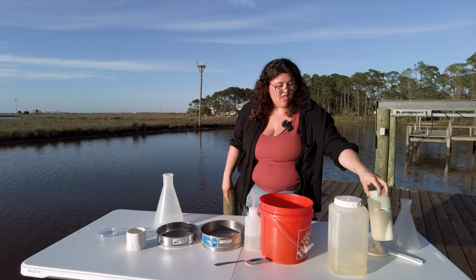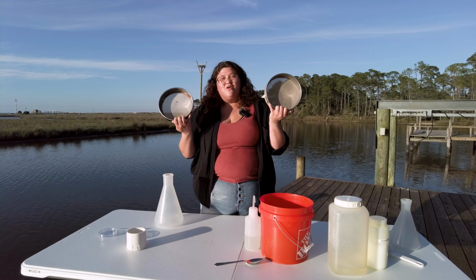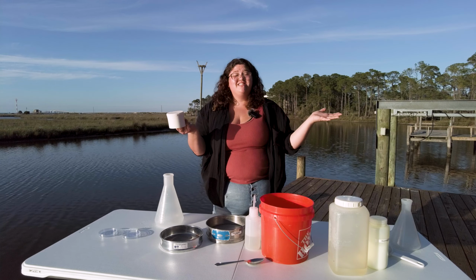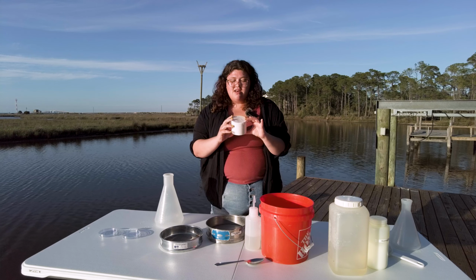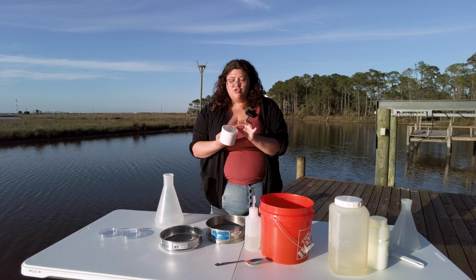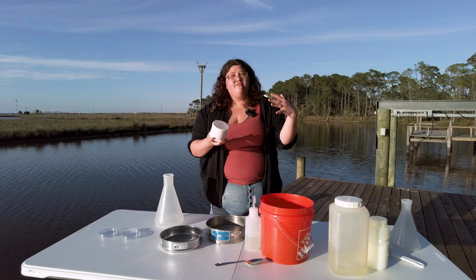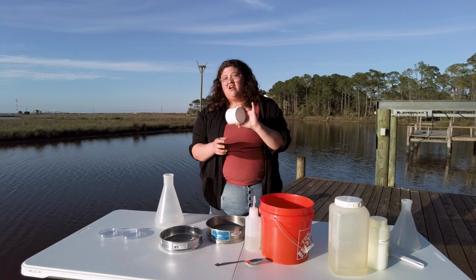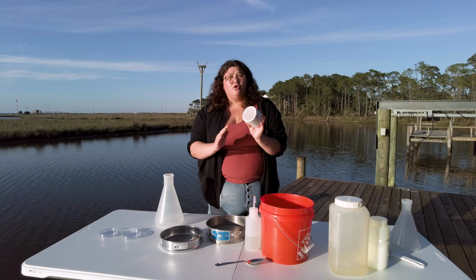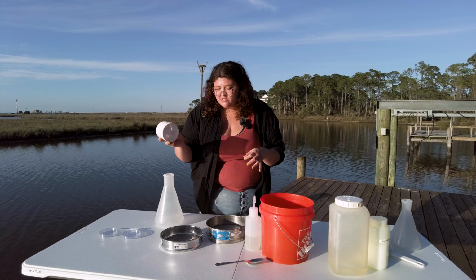For your sieves, you can either have a sieve, if you are already in a lab, or you can make your own sieve, and this is really easy. You can just go onto Amazon. We'll put a link in the video notes below. Get some mesh. This is 65 micron mesh. Buy a sheet of it on Amazon and a piece of PVC pipe that, again, you can get at any hardware store. You might just have a piece laying around, and you just literally super glue the mesh to the bottom of the PVC pipe, and you have your very own sieve. So you can make your own at home.